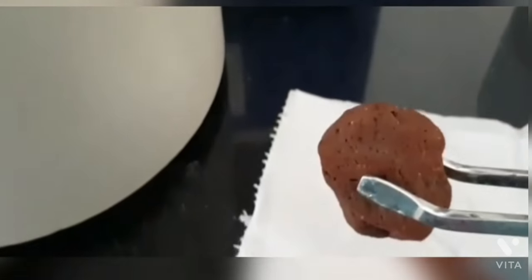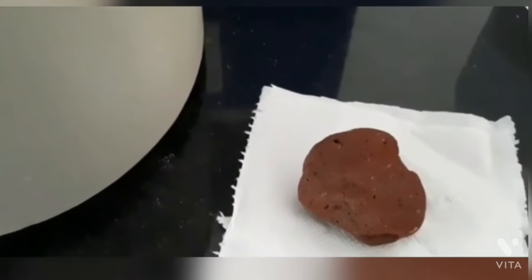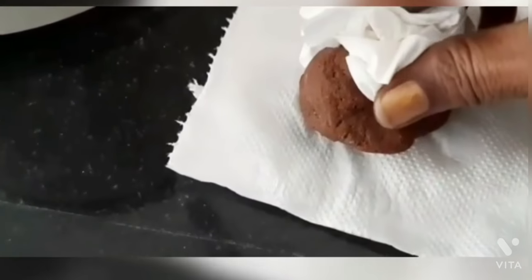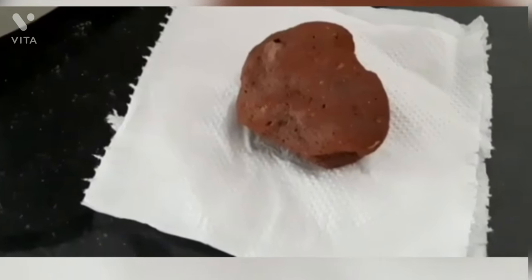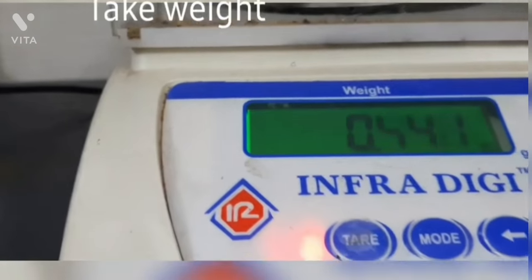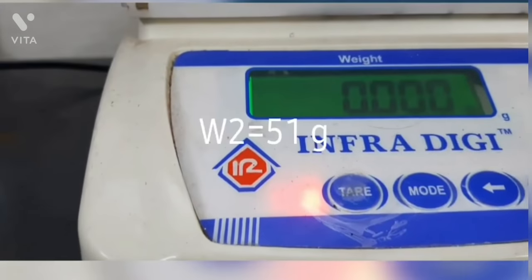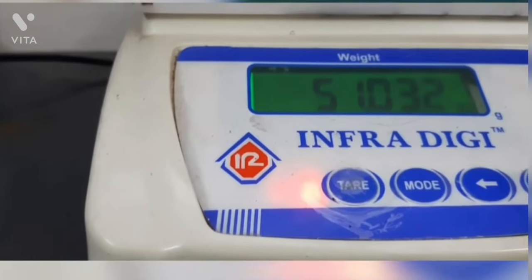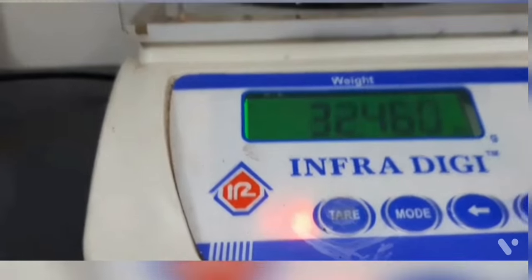It is wiped using the tissue paper to remove excess water. When the sample has reached room temperature and excess water is removed, it must be weighed. It is obvious that now the weight will be more than the initial weight because the pores of the refractory are filled with water. The initial weight was around 49.1 grams, taken as W1. After boiling for about 15 minutes in distilled water, the sample now weighs around 51.1 grams, taken as W2.